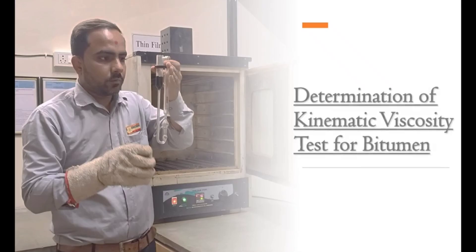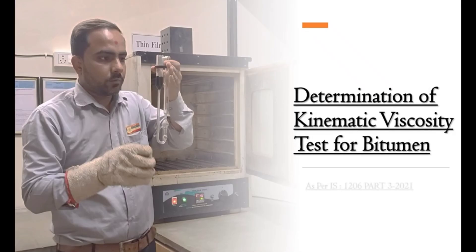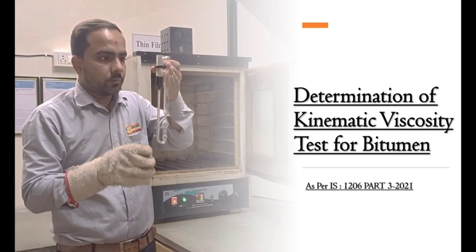Determination of kinematic viscosity test for bitumen as per IS 1206 Part 3, 2021.